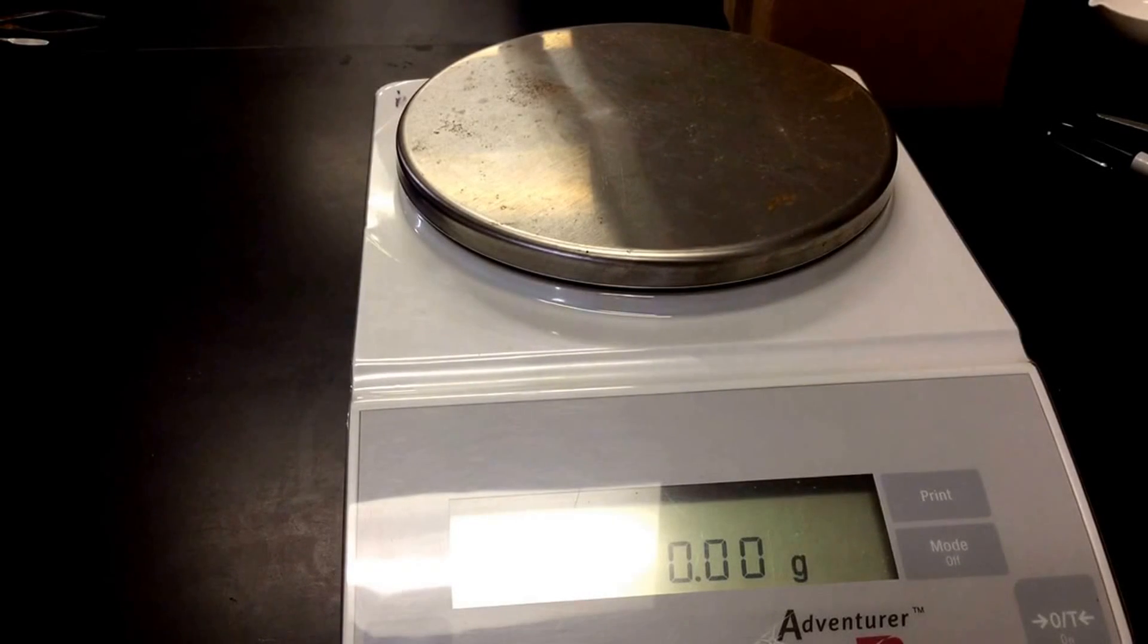Hey everybody, this is Mr. Mott. What I want to do is go over our lab determining the empirical formula of a hydrate. The first step you're going to do is you're going to weigh out and get the mass of your evaporating dish.